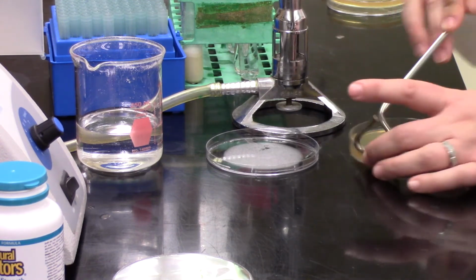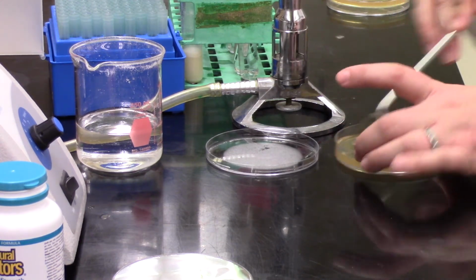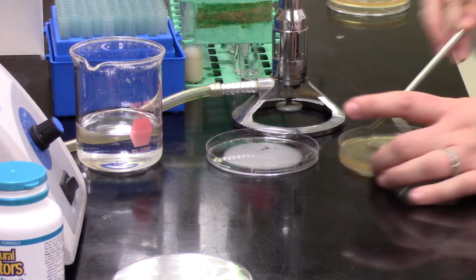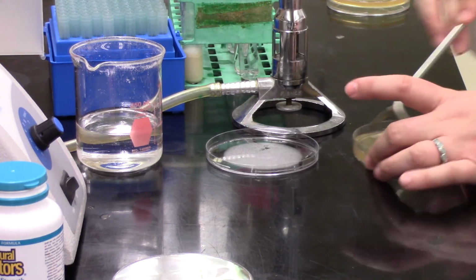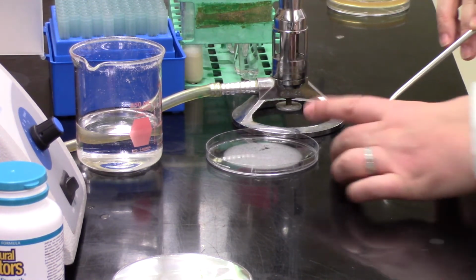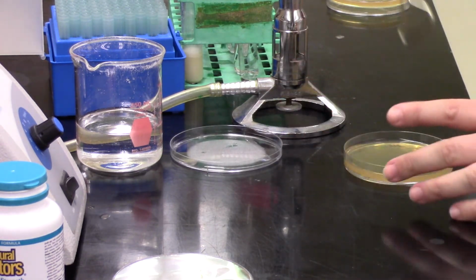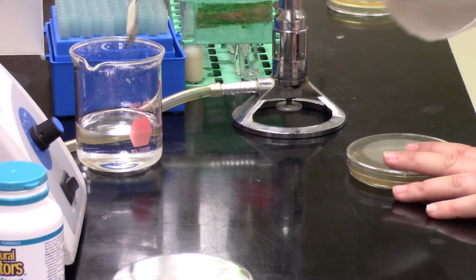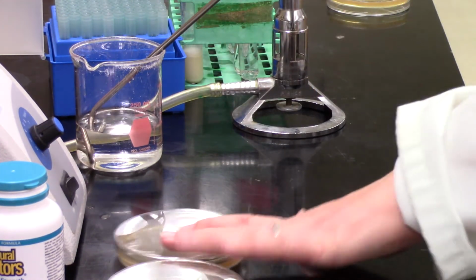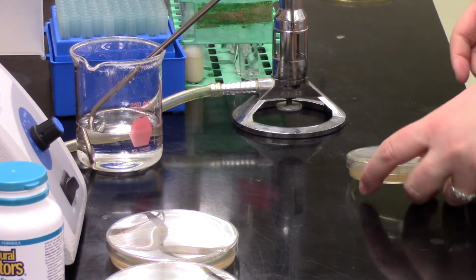So now she's doing the hand rotation where she's just moving it with her hand and going back and forth with the spreader. This is actually typically what I do. I think I just worked in labs where we never had the turntable, so we did this if we needed to spread plate bacteria. And now she's finishing off her last little outside rim around the plate, and that looks good. Back into the ethanol for the spreader, on to the next plate.